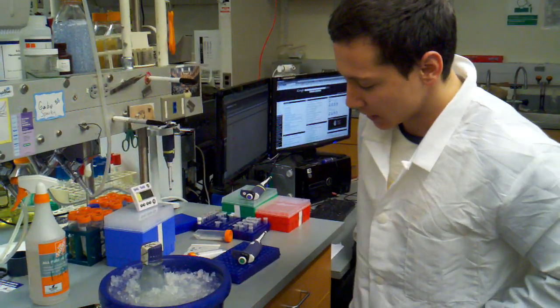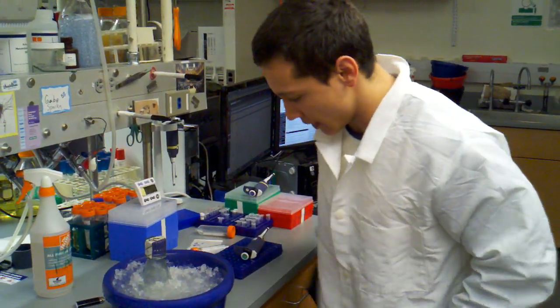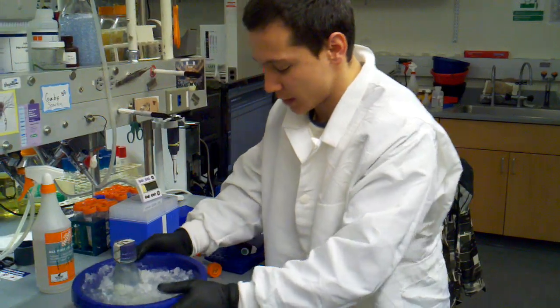And then slosh it so that we can get this culture as chilled as quickly as possible. That's going to give us slightly better efficiency. And just want to shake that around a little bit.